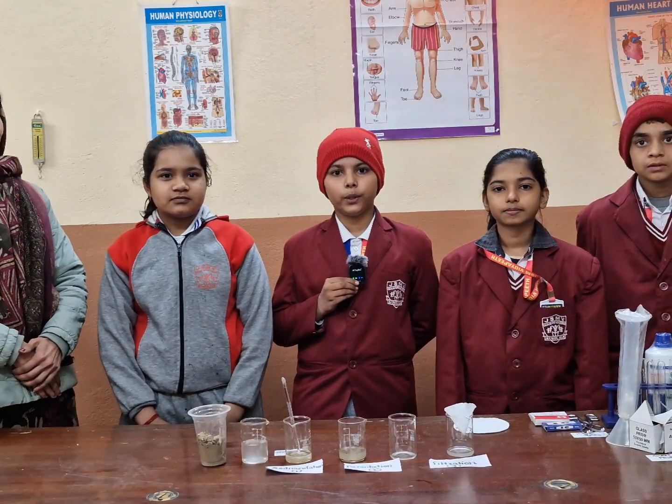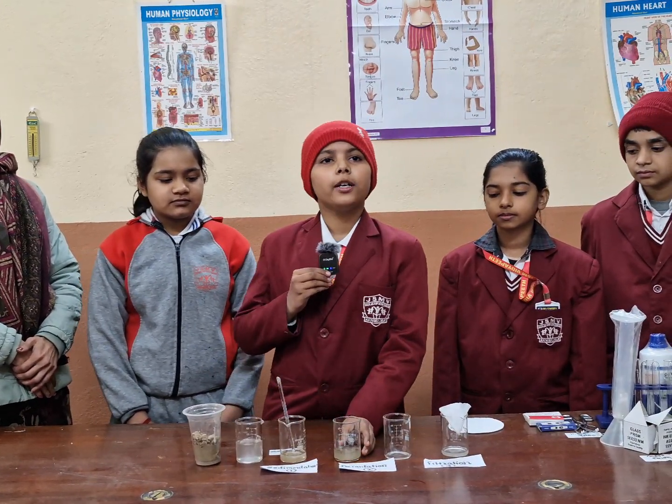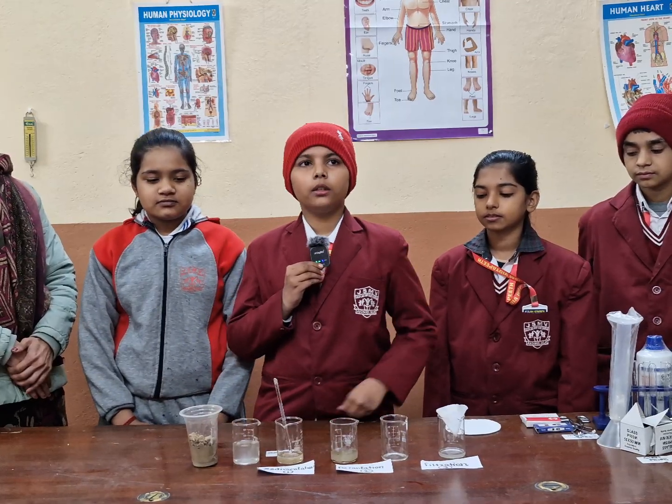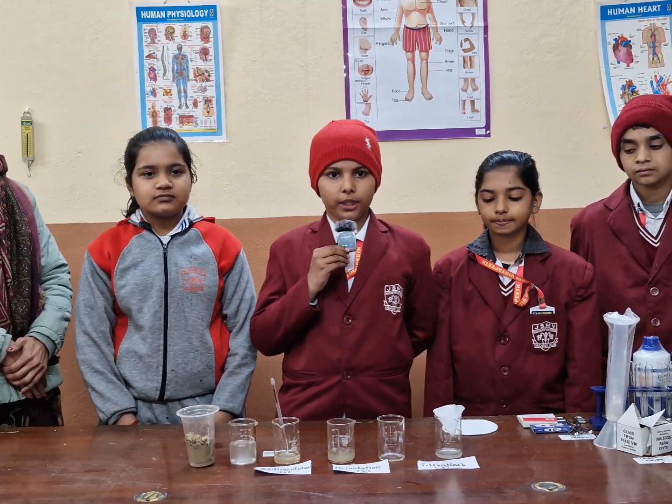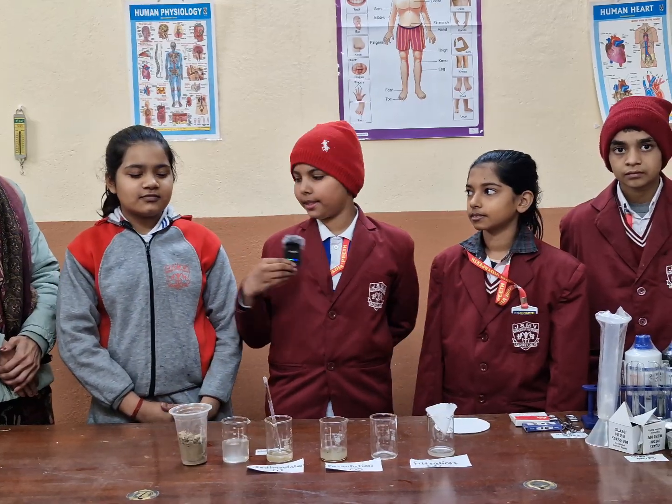Good morning. Today we do a science experiment on the separation of a solid and liquid mixture. Let's make the science interesting.